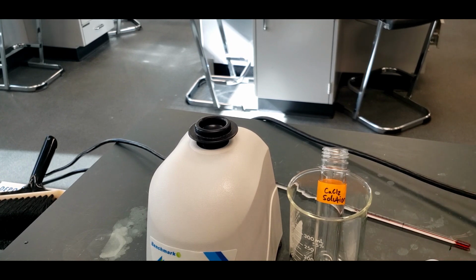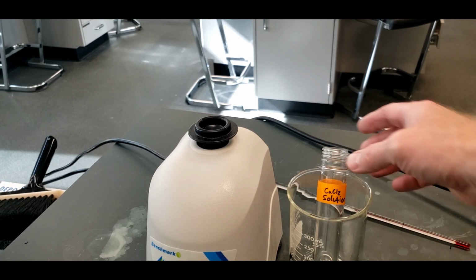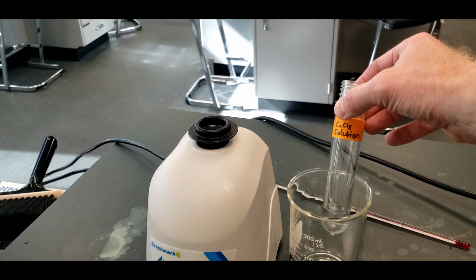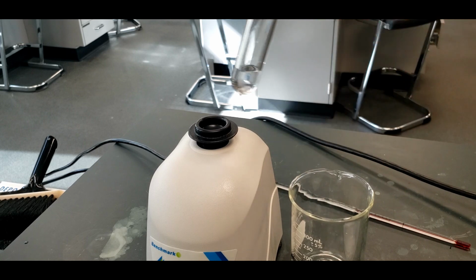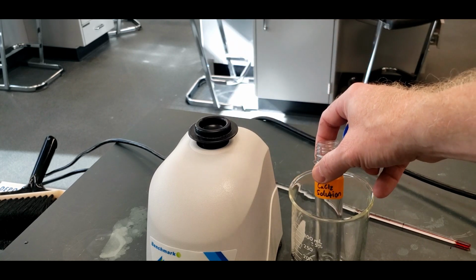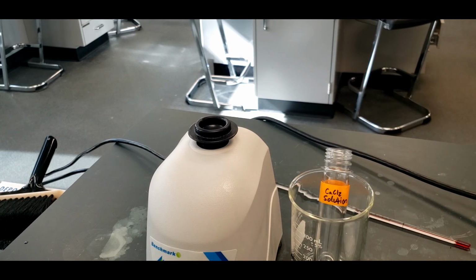And whatever it turns out being for mine, it was 16, that's cool. But you have to write down exactly what it is, but you have some play in those last two digits. So I have 4.416 grams of calcium chloride here, and I'm going to put it into here, and then I'm going to cap it off, and I'm going to use this bench mixer to mix it up thoroughly, and then I'm going to put the thermometer in.